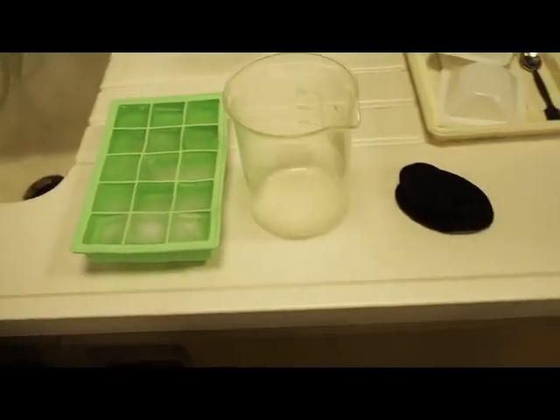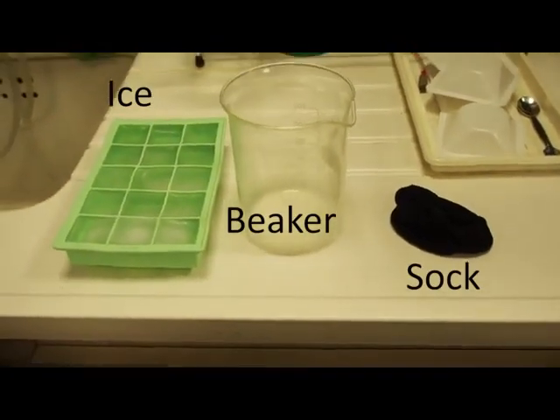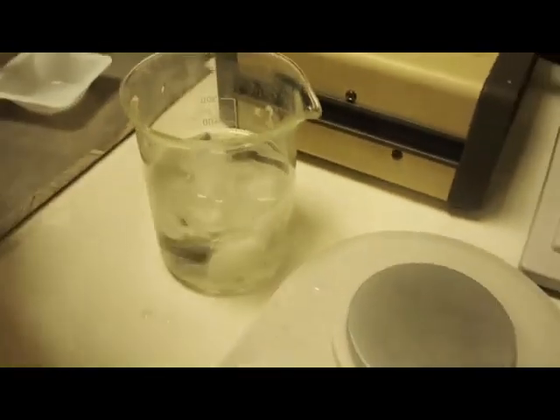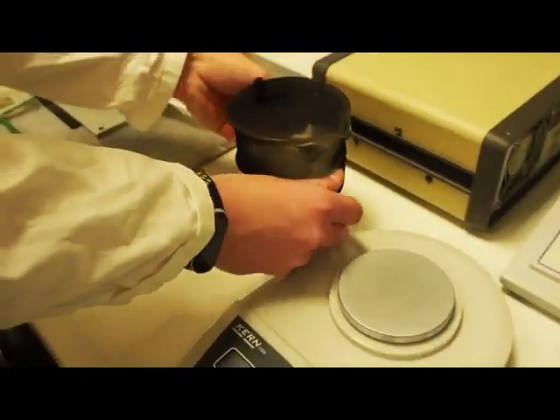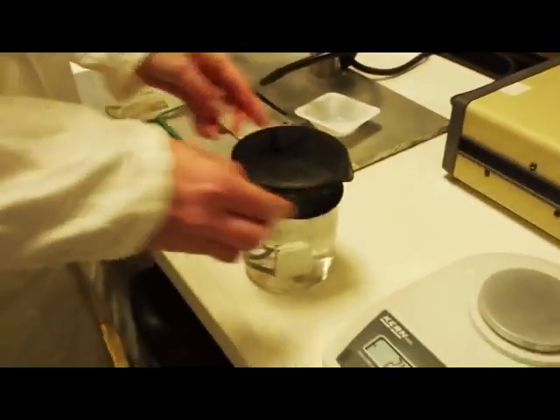Let's start with the preparation of the leech. For that we use a big beaker, fill it with ice cubes and water as a precaution to avoid stress or pain for the leech. And we present leech on the rocks, shaken, not stirred.